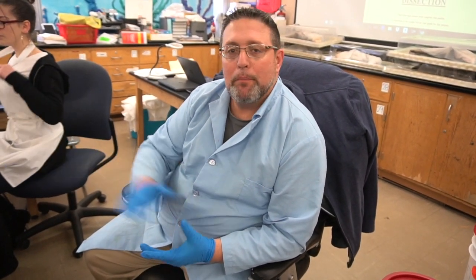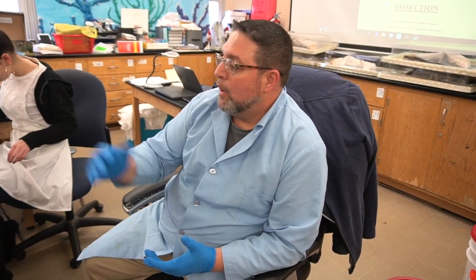This is my zoology class. We are about to dissect a dogfish shark. It is a cartilaginous fish, so its bones are made from cartilage. This is in conjunction with a comparison we are doing with a bony fish, like a perch. We did that lab last week. This week we're going to be doing a comparison to this other type of fish that's made from cartilage.